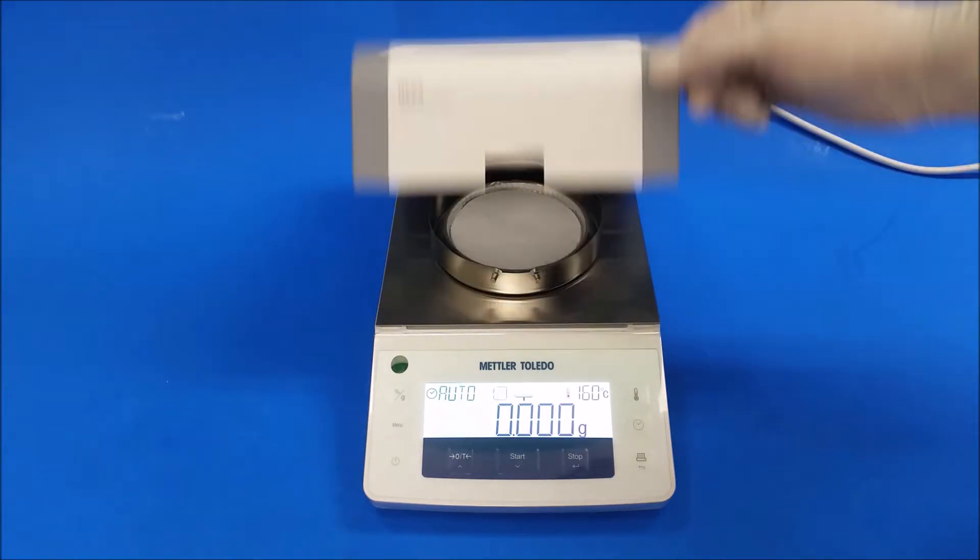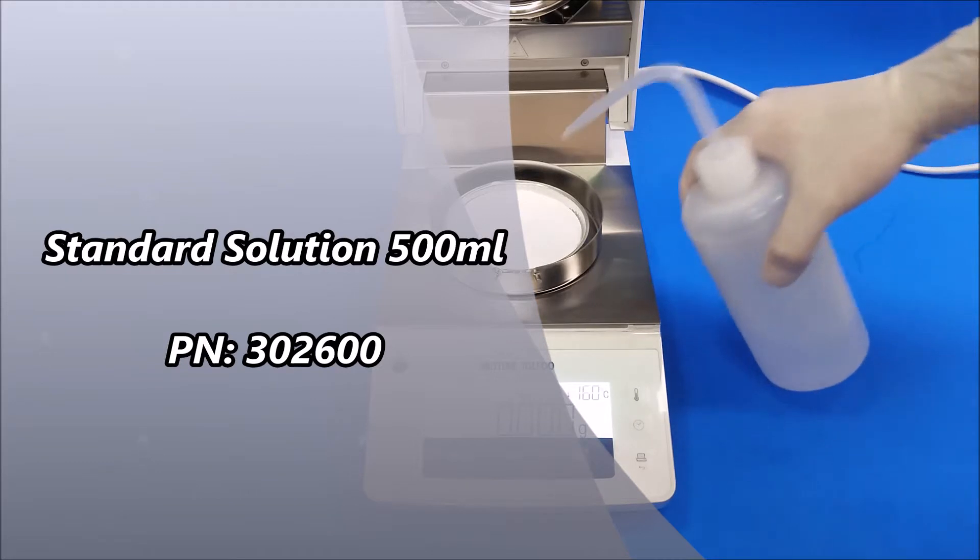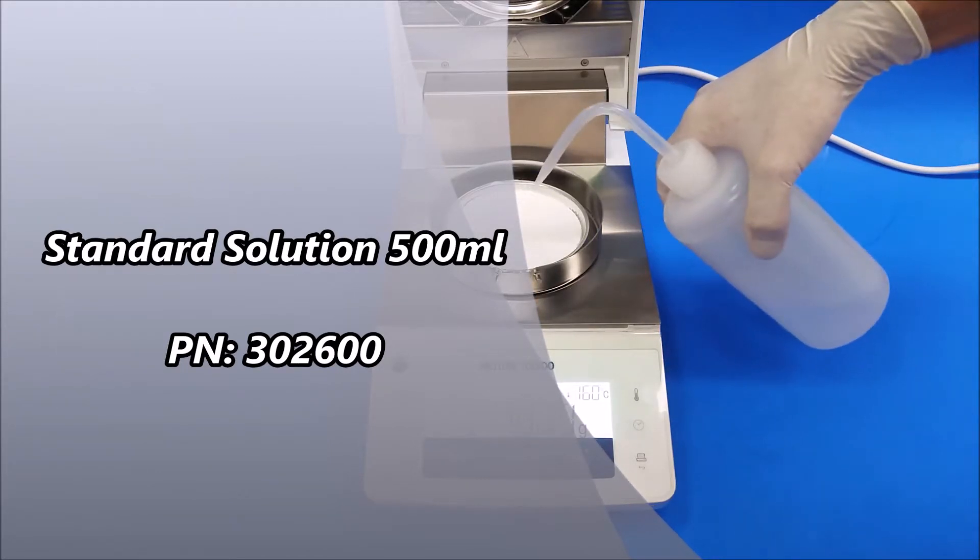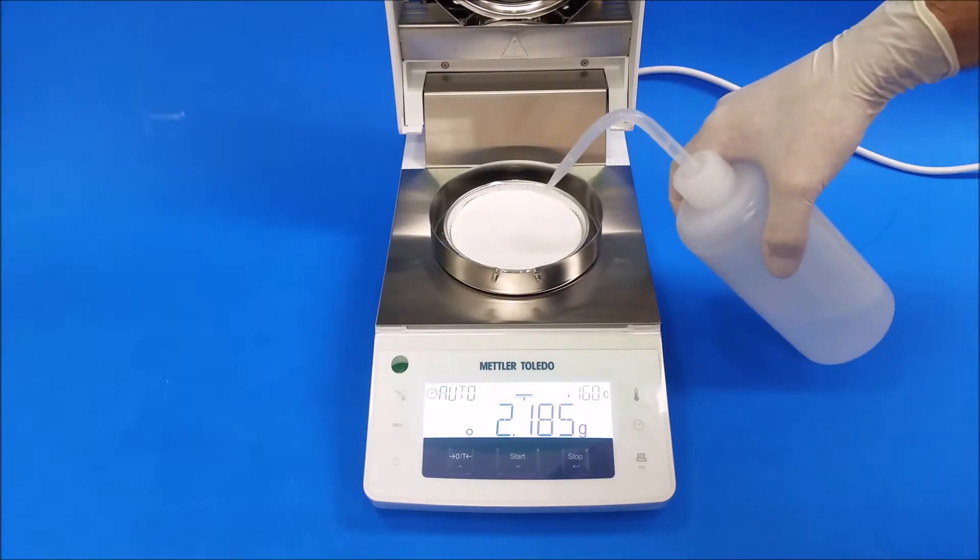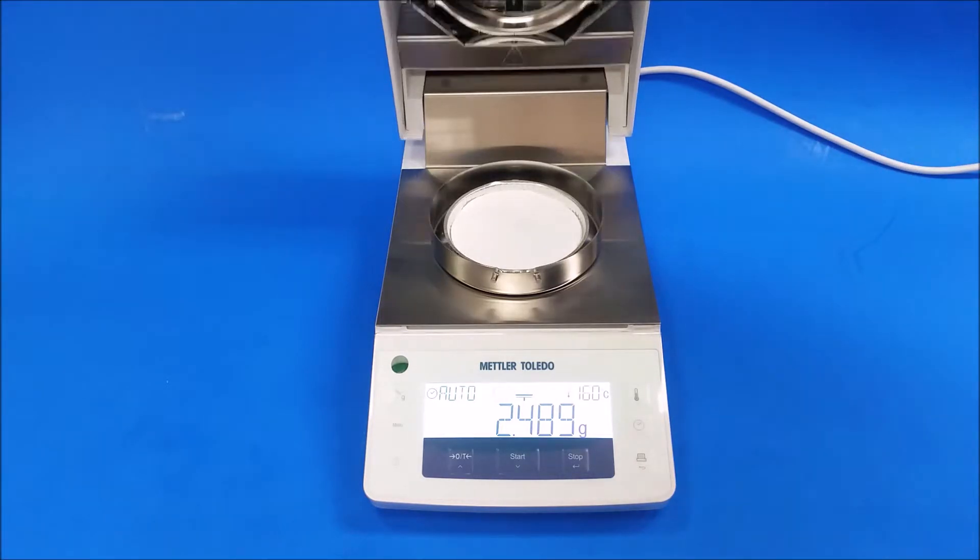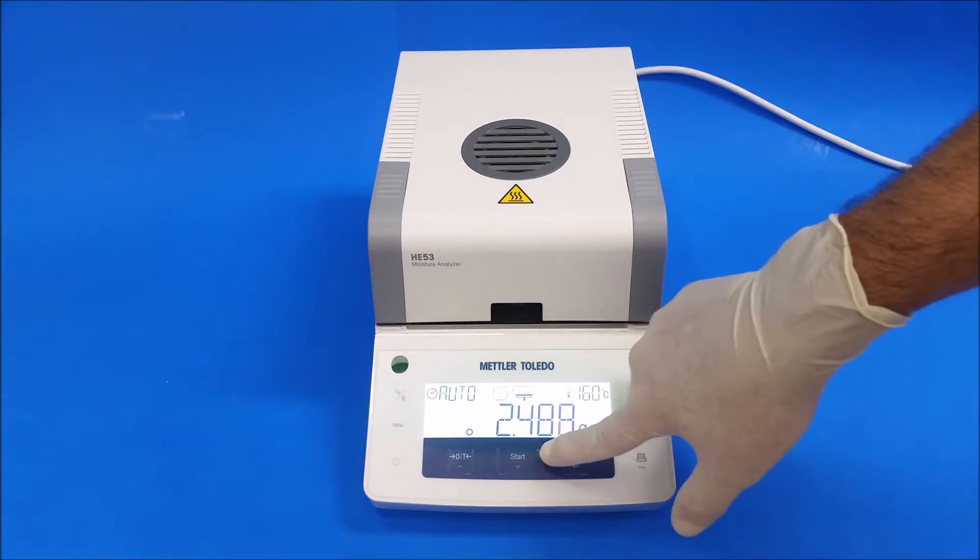Alright, now I'm just going to add my sample. I'm going to add my standard solution here, about 2.5. Close the hood and I want to press the start button.